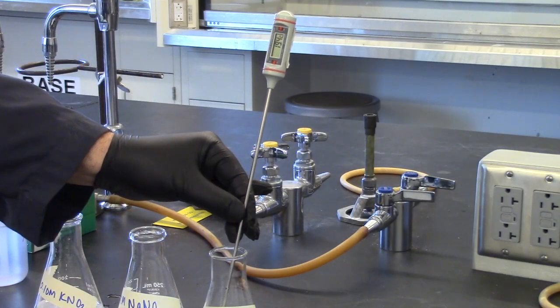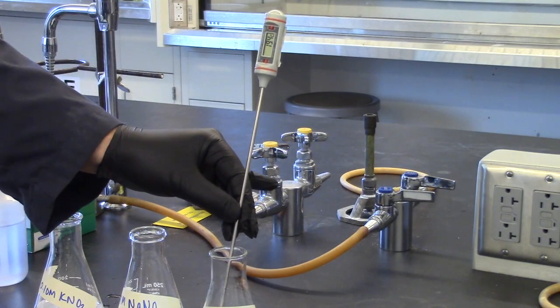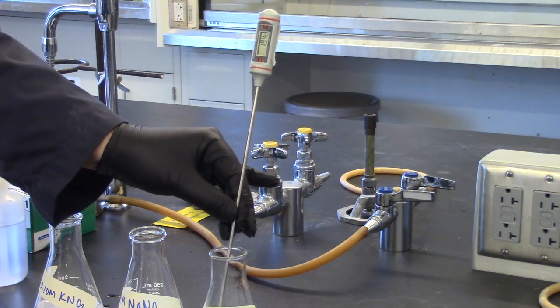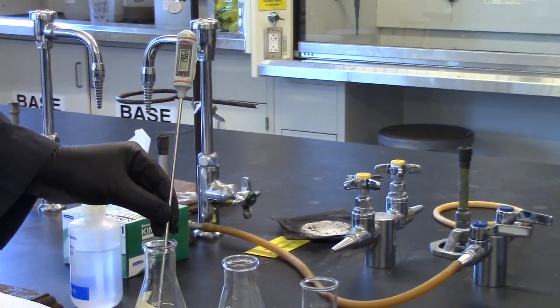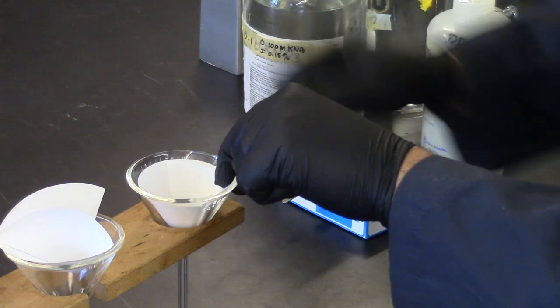Before filtering the solution, take the temperature of the potassium acid tartrate and water solution. Repeat for the remaining two solutions and record the temperature.